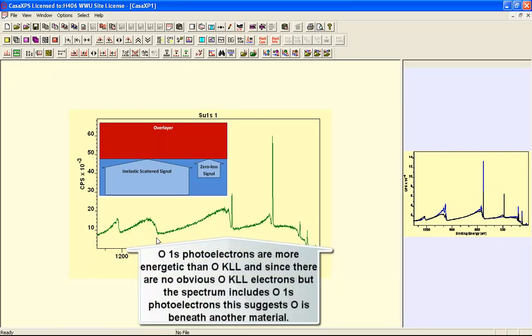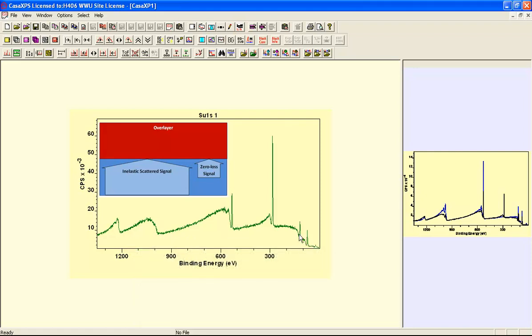So these have been completely attenuated by the overlayer of carbon, and we just see a small amount of oxygen, and that's because the oxygen 1S is at a higher kinetic energy and therefore can escape from the surface, whereas the lower kinetic energy O KLL has completely been attenuated. And we can see the aluminium is present once again because they're at a higher kinetic energy and therefore these can escape. Put together, you can see there's quite a distinct difference between these data.